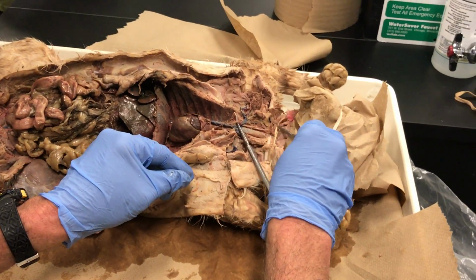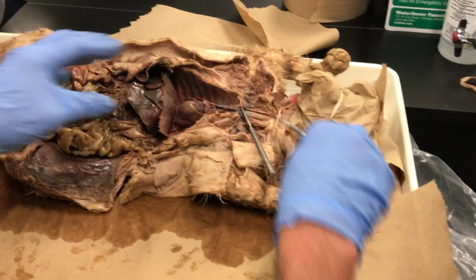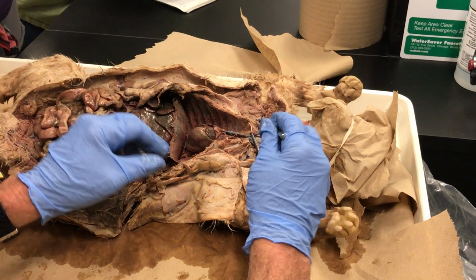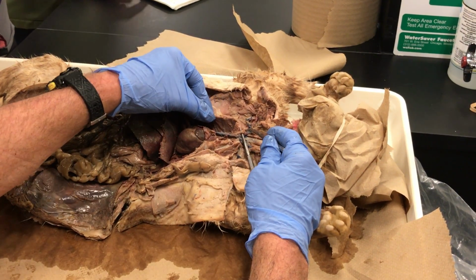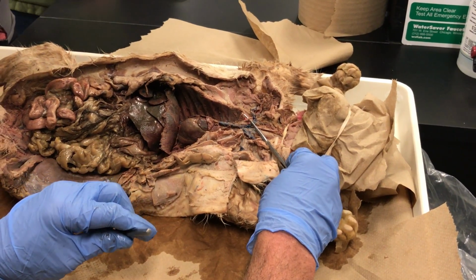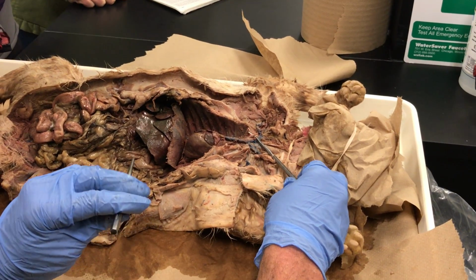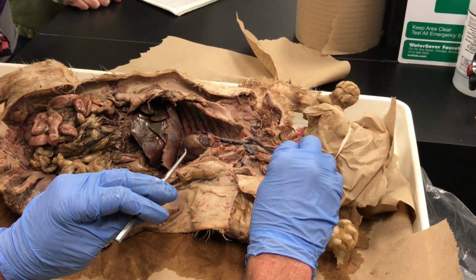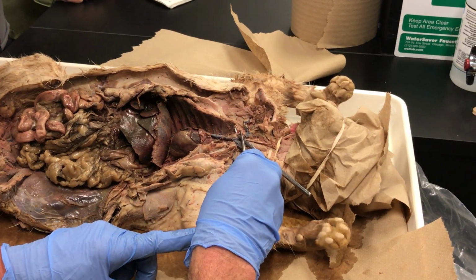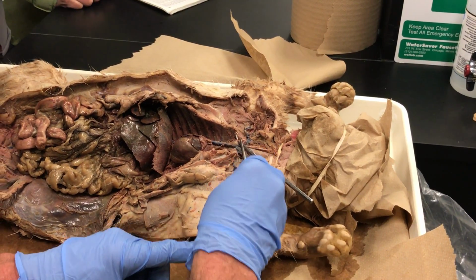See that string? That's a string, Lily, that was cut. So a cut was made, the blood was drained out, and then once the latex was injected, tied off so it wouldn't leak out. What's left of that pink tube then, right here, goes underneath the armpit. And the name for your armpit is called the axilla. So that's called the subclavian, pardon me, we got to go under the clavicle first. So right here, as soon as it's branched off from that common carotid, that is called the subclavian, beneath the clavicle, which would have been here, and the bone has been taken out.